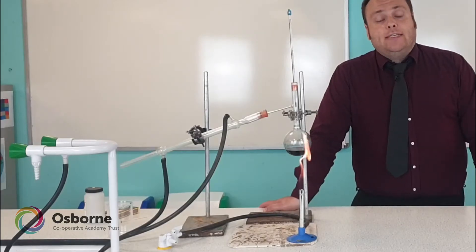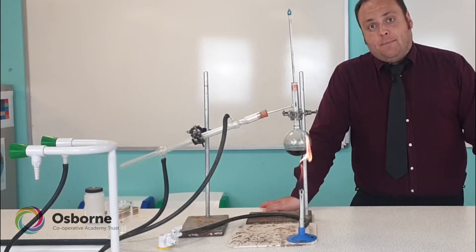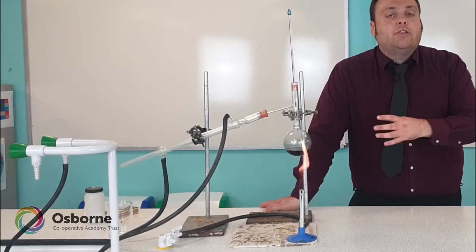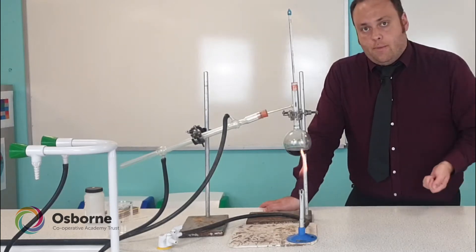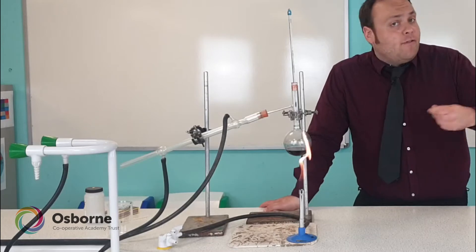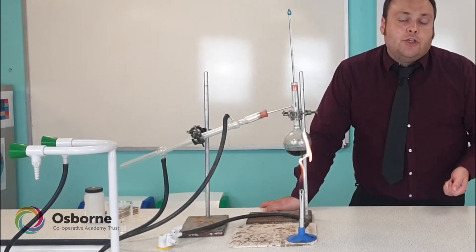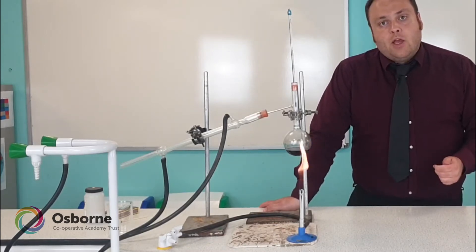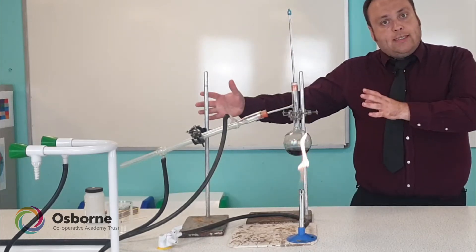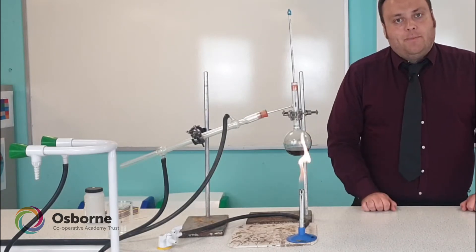The equipment we use for distillation is called a still, and I've got one set up over here. This is not what the equipment looks like for your Core Practical, mostly because it contains quite a lot of expensive glassware that very few science departments are able to give out for students. So I'll demonstrate distillation with this still setup and then do it afterwards with the Core Practical setup.